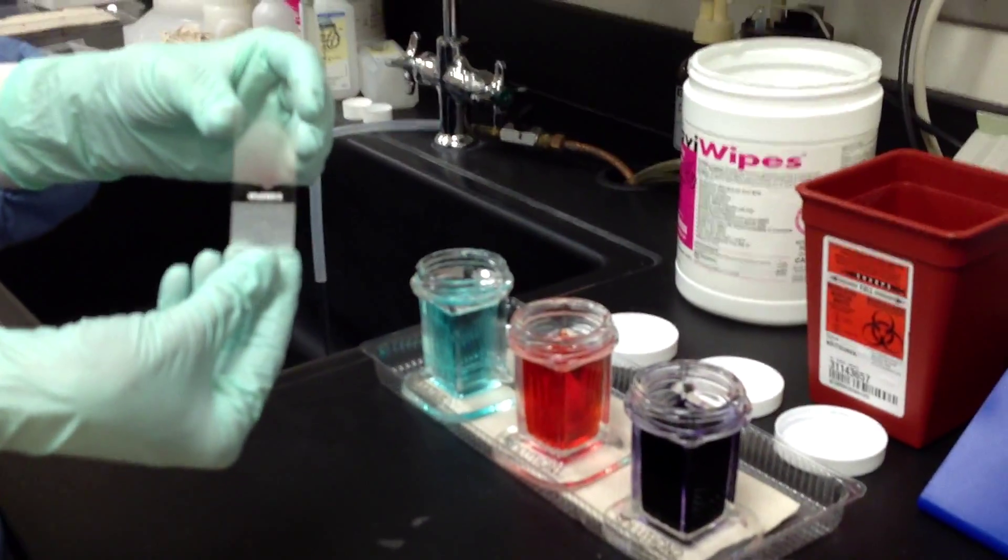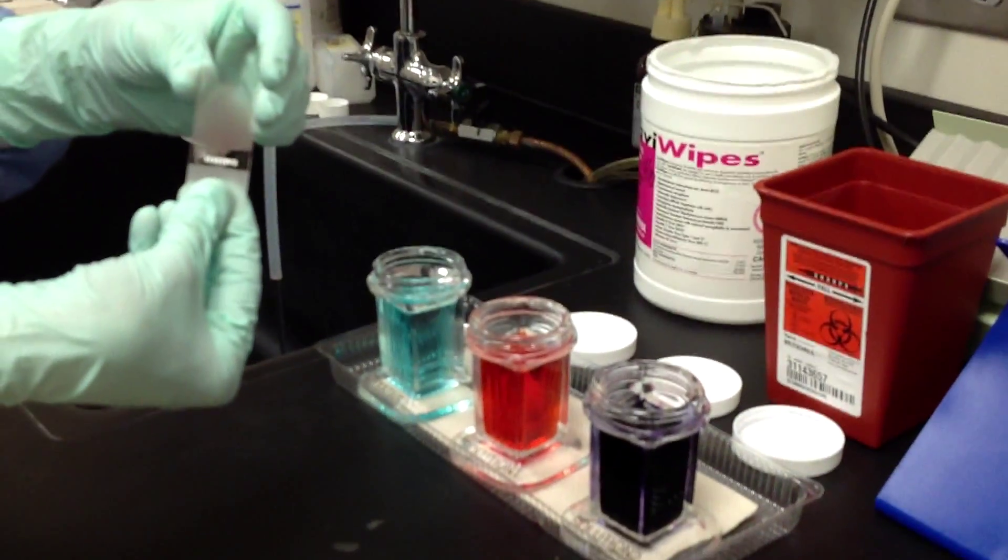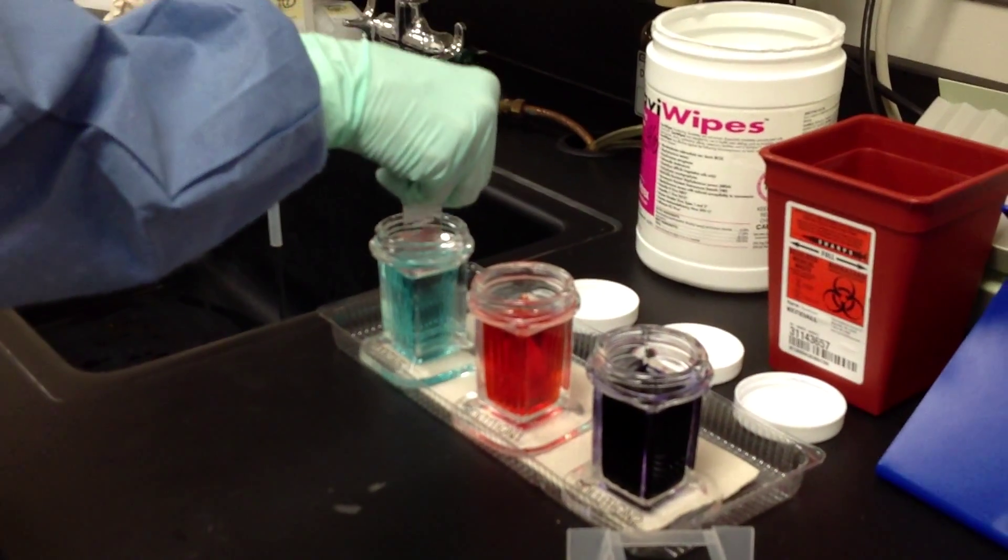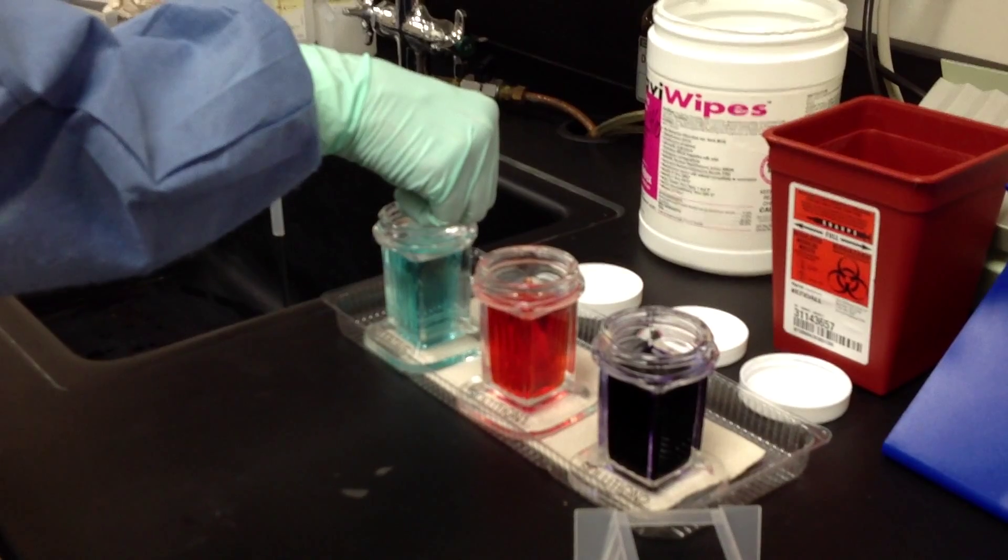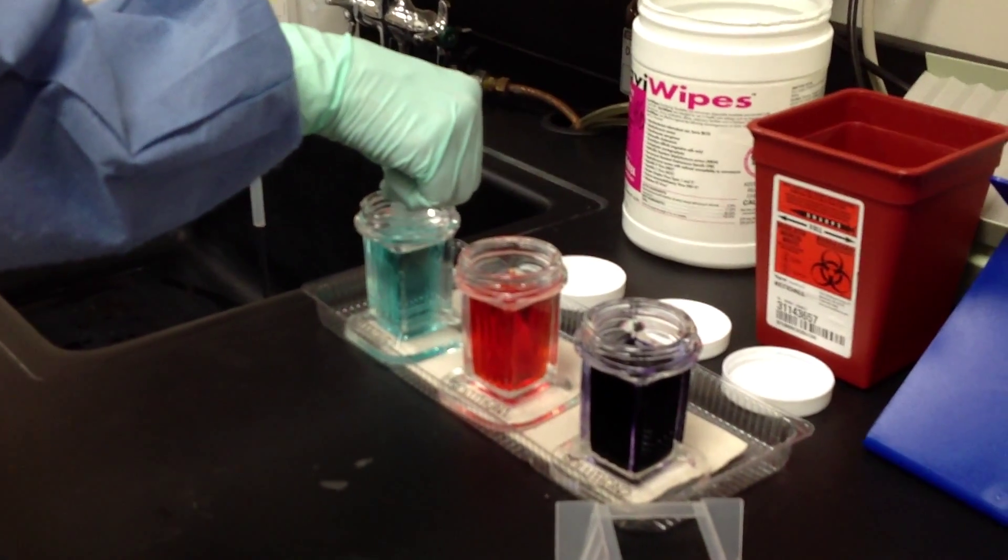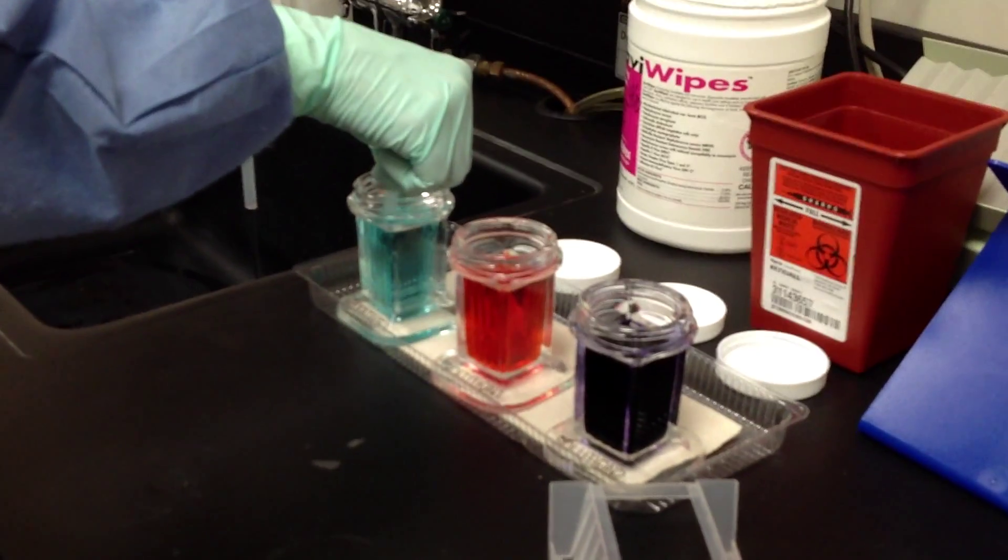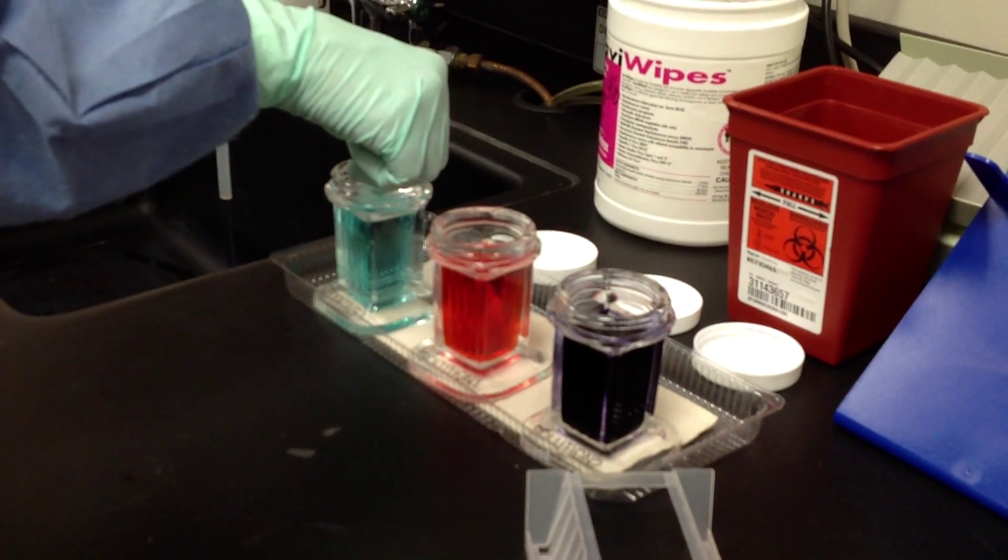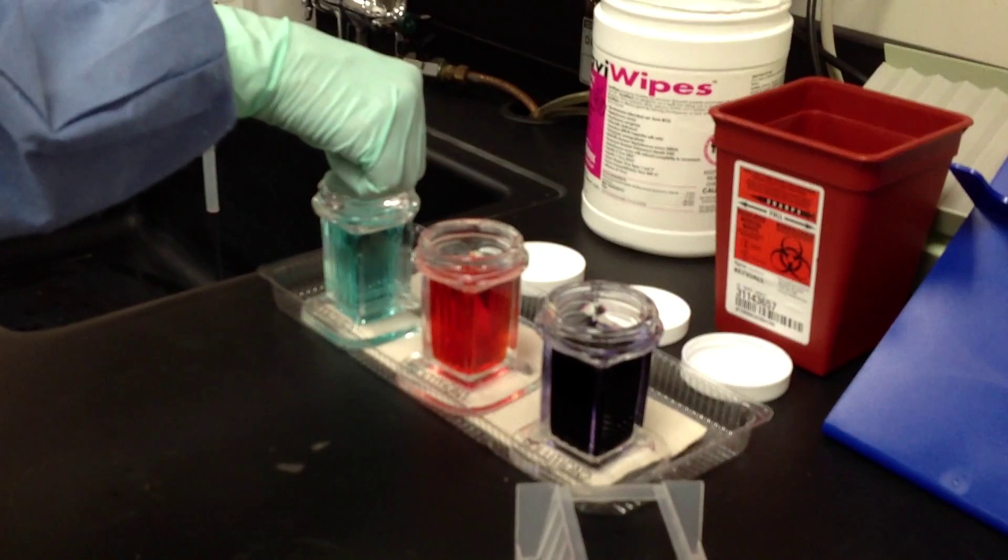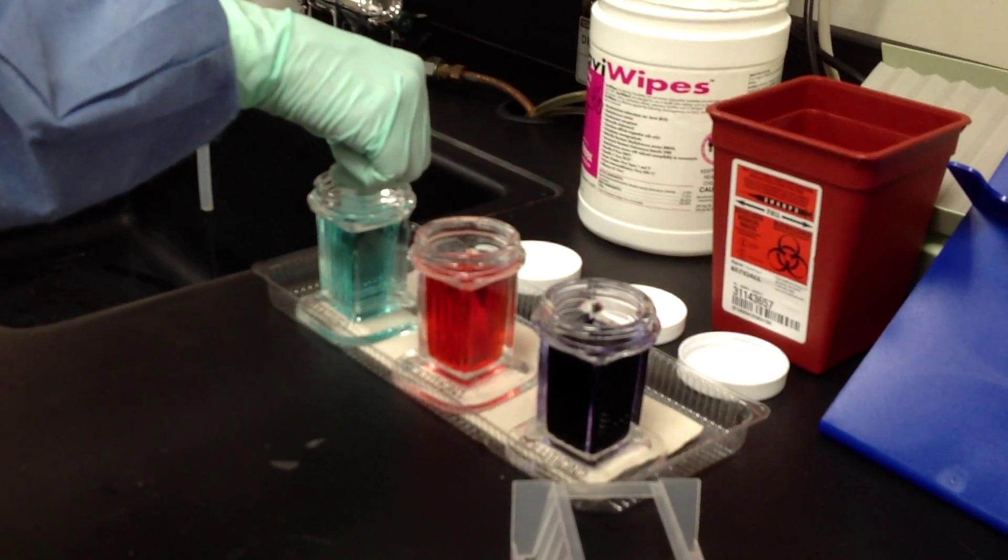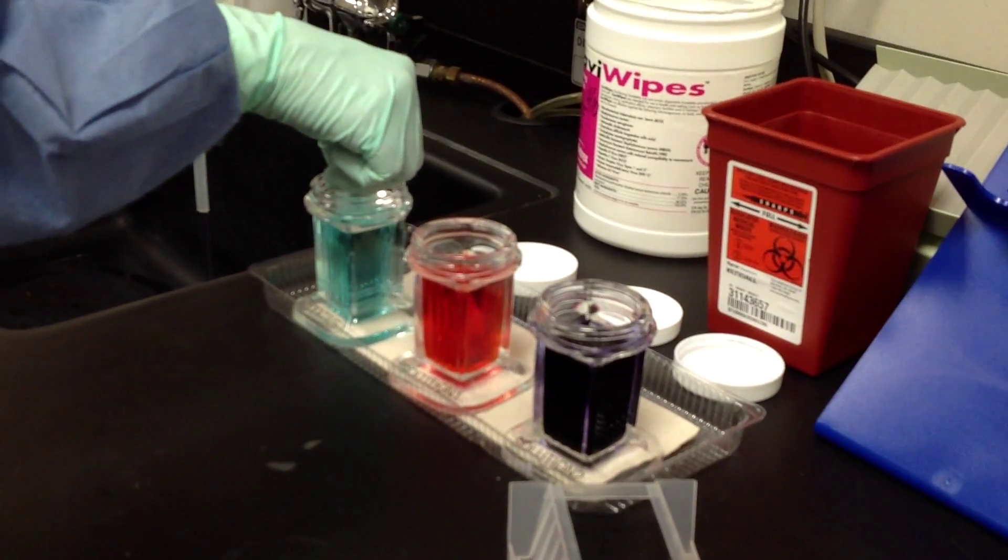Using the label as the handle, we're going to put it into the fixative. Our directions say all of these are five one-second dips. However, with the fixative, you cannot over-process, so we just want to leave it in there a few seconds to make sure that it gets good and fixed to the slide. Otherwise, we lose all of our blood.